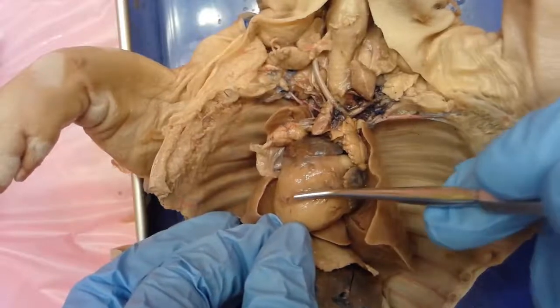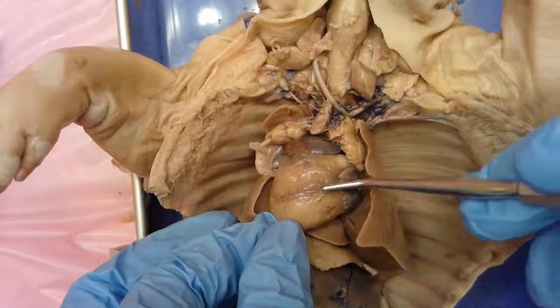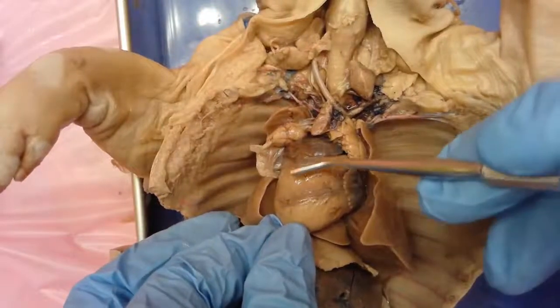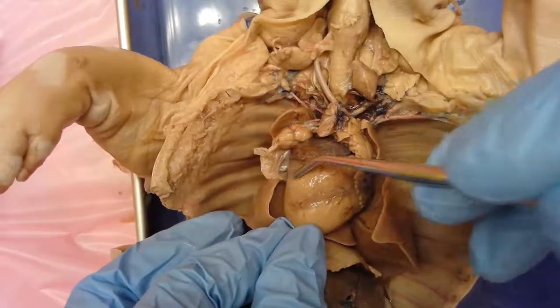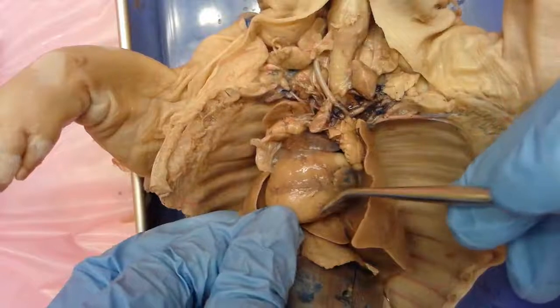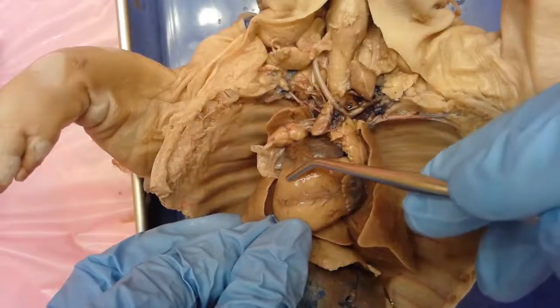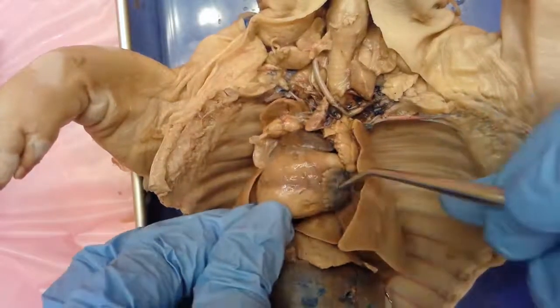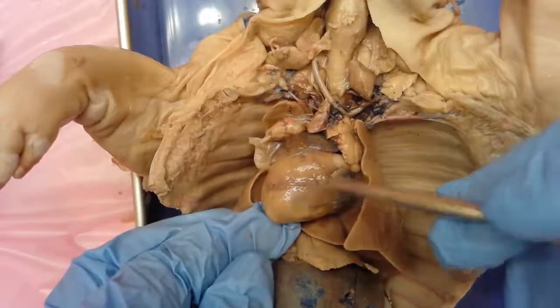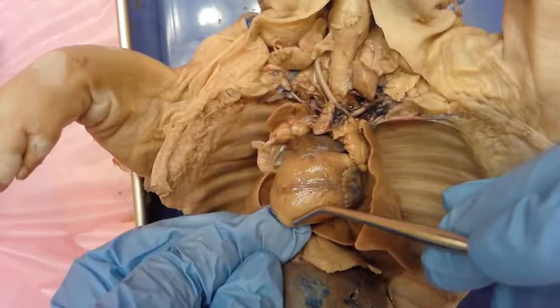This big, huge main coronary artery there is kind of our defining line to be able to divide the right ventricle on this side from the left ventricle that's on this side. So: right atrium, right ventricle, left atrium, left ventricle. And down here, this tip is called the apex of the heart.